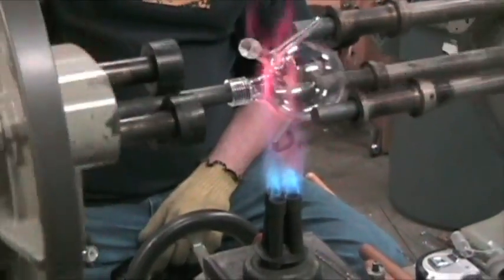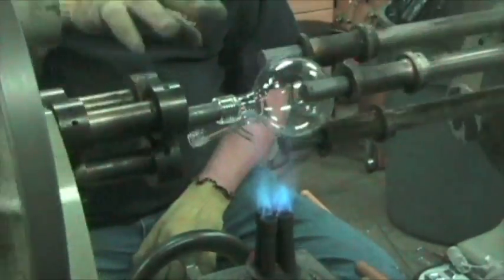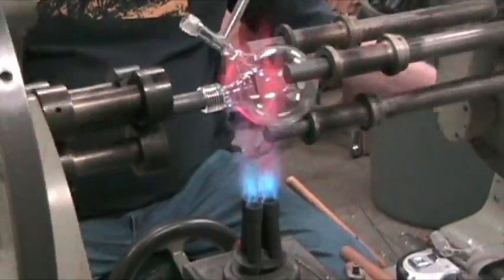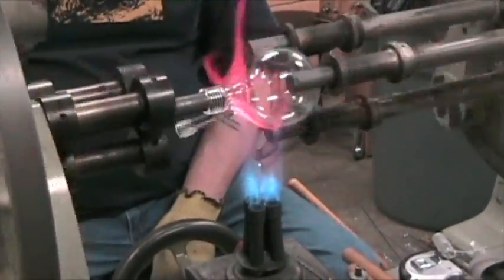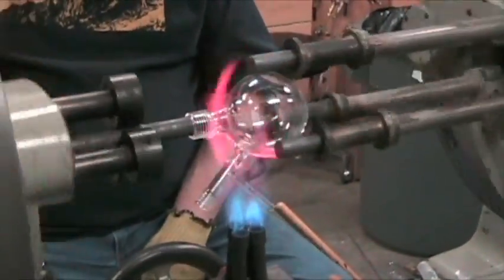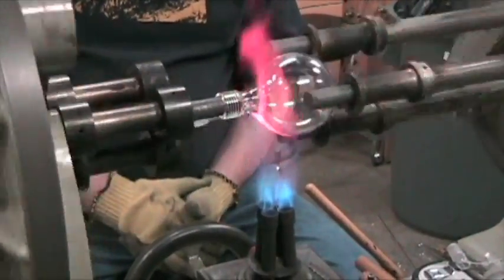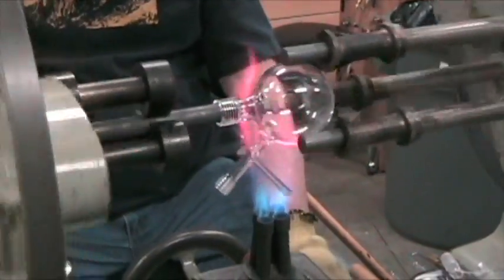You can see the unequal flames when it goes bright orange and then it darkens, bright orange, darkens. That indicates there's stress on one side of the glass and there's not stress on the other. By letting it turn for a while in the same flame, they'll equalize where they're all the same temperature. Then it's what they call stress relief somewhat. We'll still run it in the oven overnight to completely stress relief the whole piece, but this makes it withstand everything during the processing much better. Yeah, it's all starting to stay the same color now.